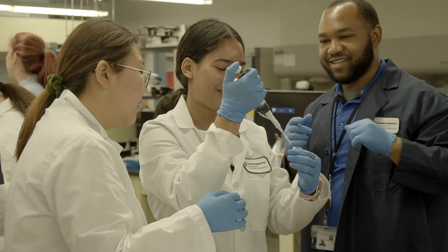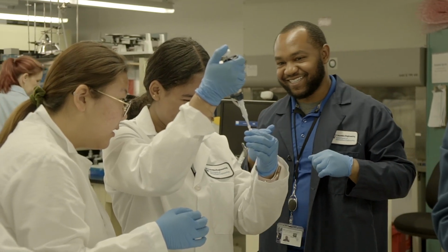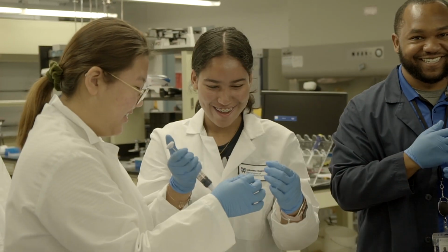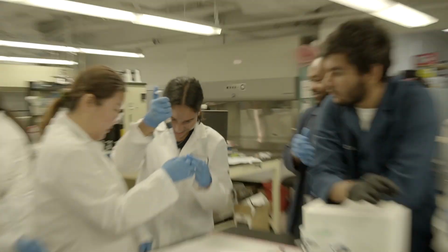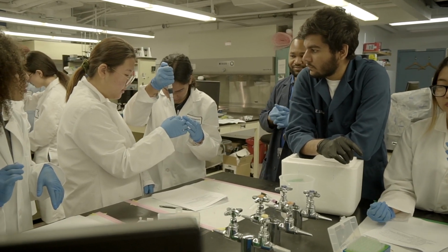And then when you're dispensing it, there's a paper you see and then you do it. That explains why you weren't seeing anything. Alright, we're all good. 2 to 20, all right.